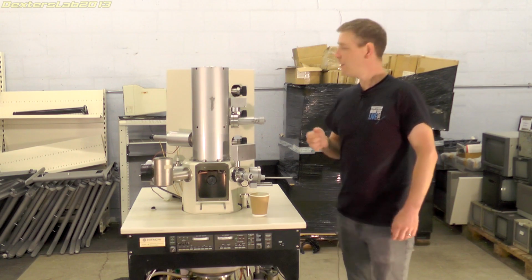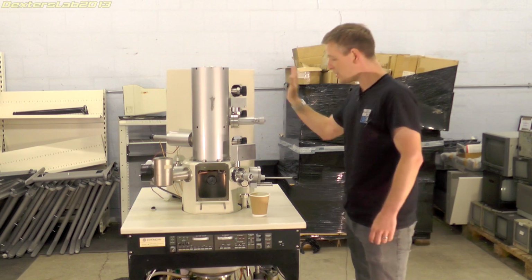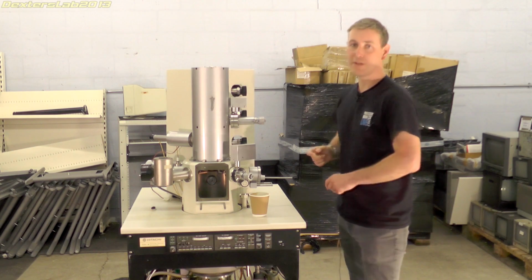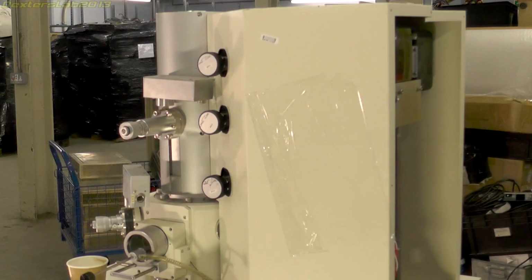So let's take off these covers. They're actually not screwed into place because I've had them off before. So I'll just remove these out of the way. I'll move the camera around and you can see them in a bit more detail.